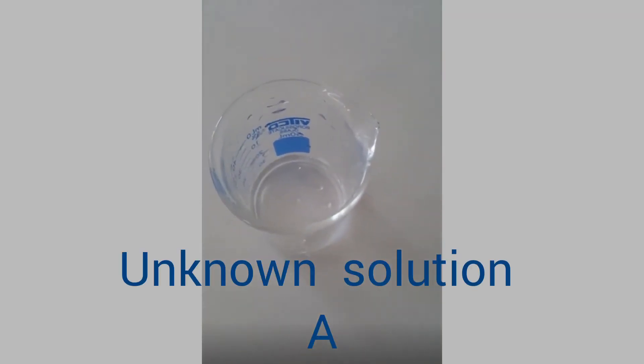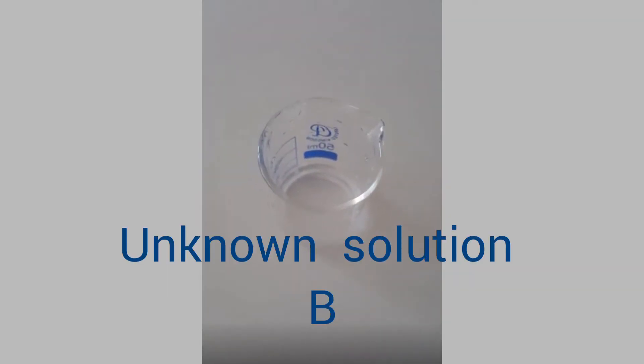To do this experiment, I have taken two unknown solutions. You can see in the beaker that is a colorless solution. I have no idea which one is acid, which one is base, or if it is a neutral substance.